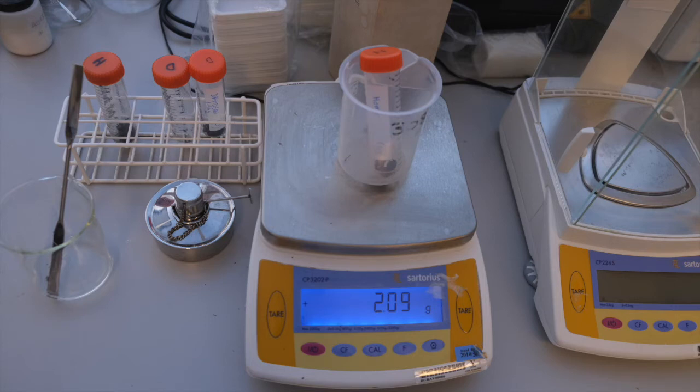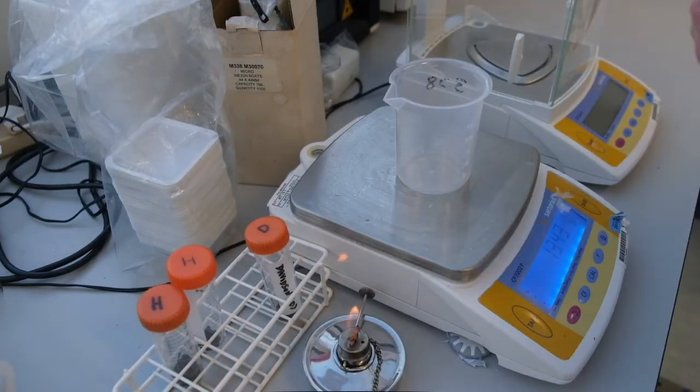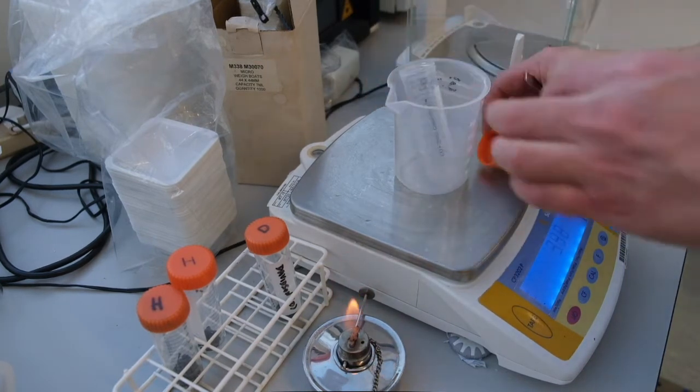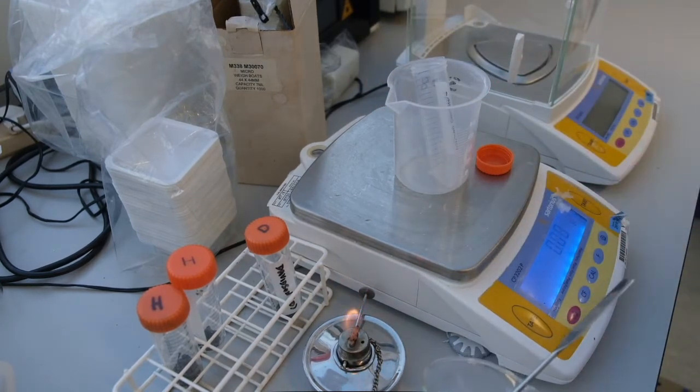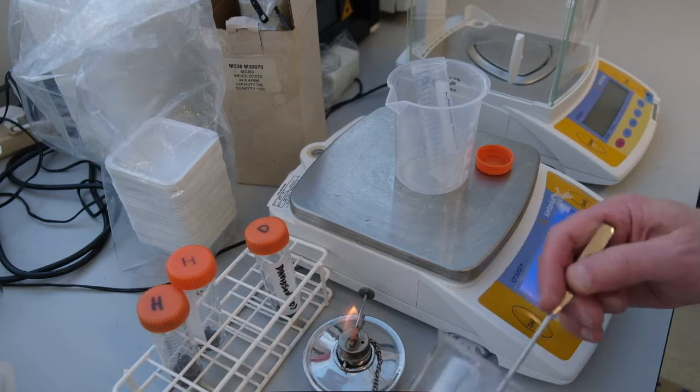Sample H is 2.09 grams. We now do exactly the same thing for sample D.